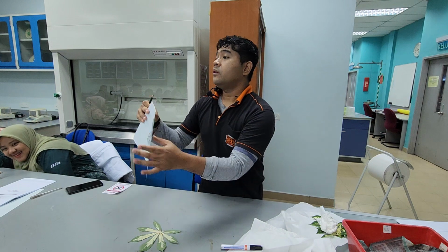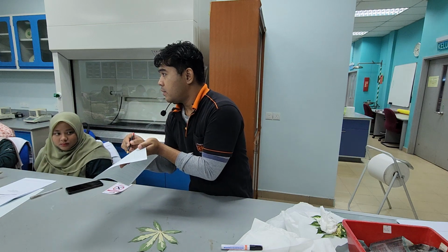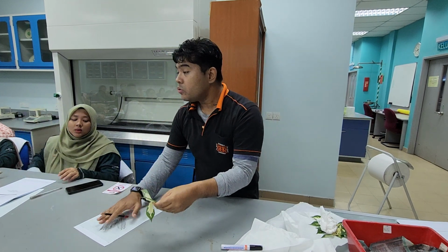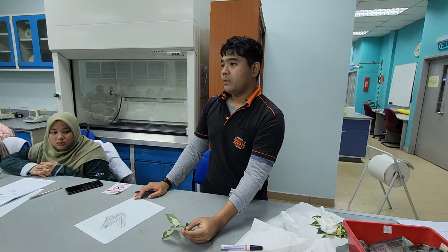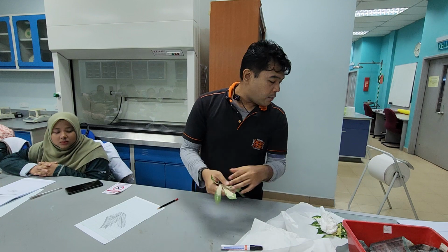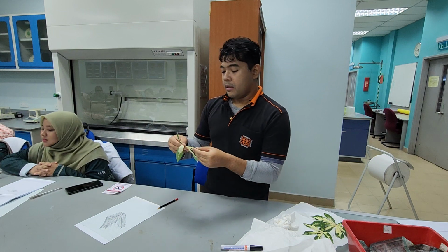Okay, so can you see? What you are going to quantify later on is the outline of the leaf. If you can fit the whole palmate shape of this leaf onto one graphing paper, that's good, so do that. If you can't, you can remove the fingers one by one. It's up to you. You might want to use a small one, or a medium one.